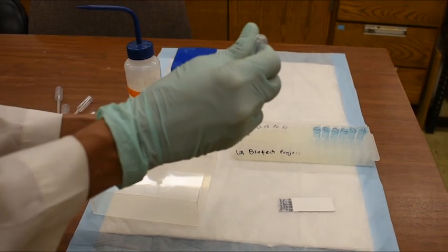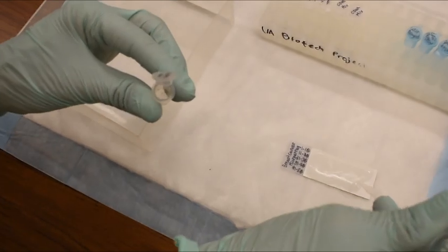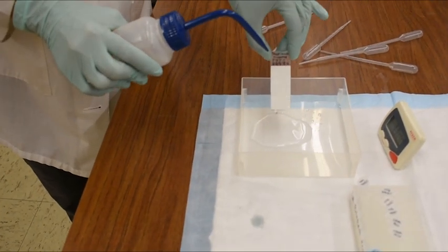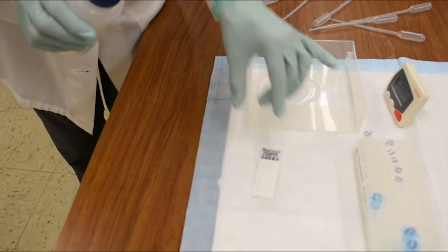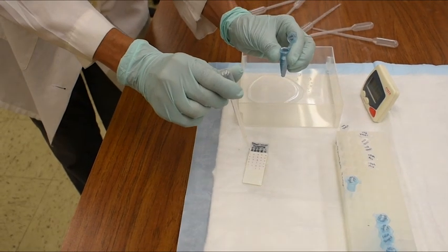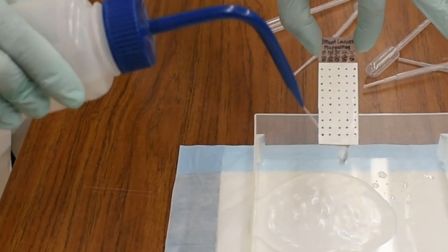Now we will go through the lab simulation and go through the protocol. First, the cDNA mix is added to the slide and allowed to sit for 5 minutes. After the 5-minute incubation, the cDNA is washed with microarray wash solution. This is a very low concentration detergent and salt solution to wash off any nonspecific hybridization. Then we add the color reagent solution. This will react with our labeled cDNA so that we can see the blue and red of these labels. Let this incubate for 30 seconds and again wash away with microarray wash solution.